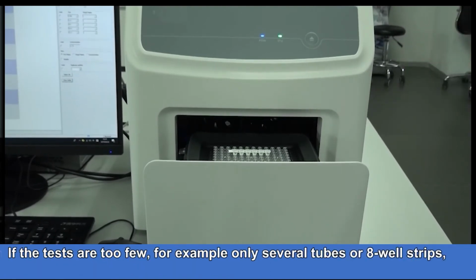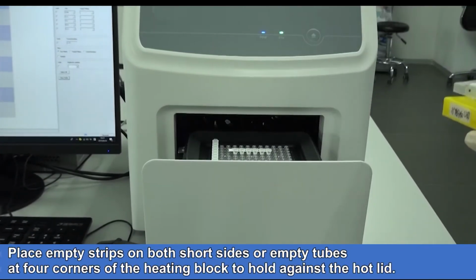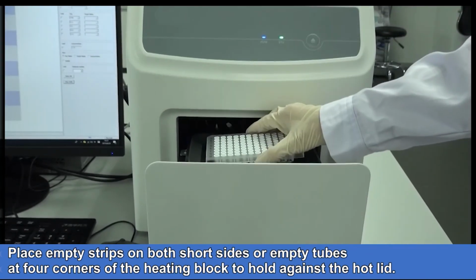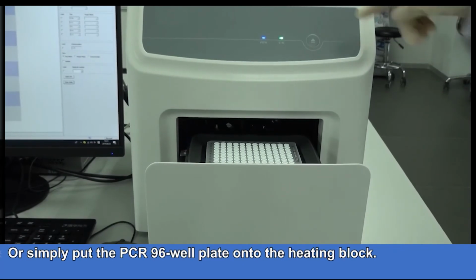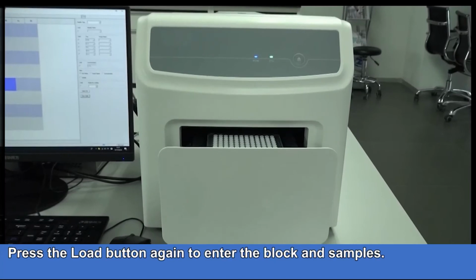If the tests are too few, for example only several tubes or 8 well strips, place empty strips on both short sides or empty tubes at 4 corners of the heating block to hold against the hot lid. Or simply put the PCR 96 well plate onto the heating block. Press the load button again to enter the block and samples.